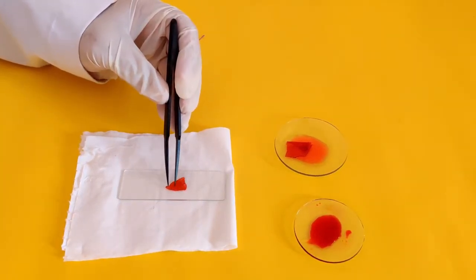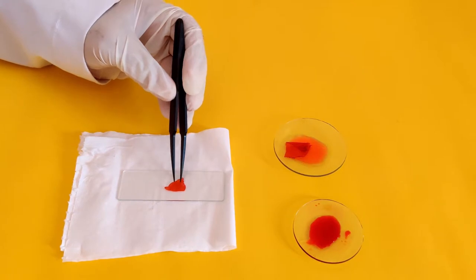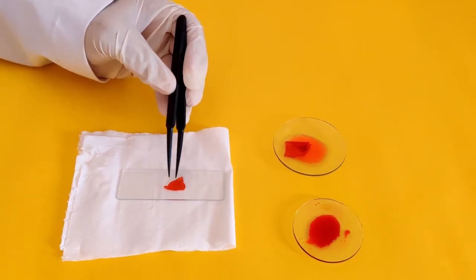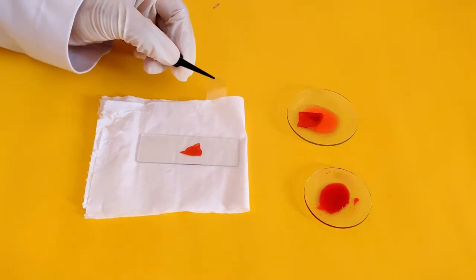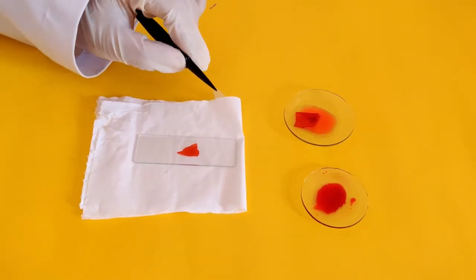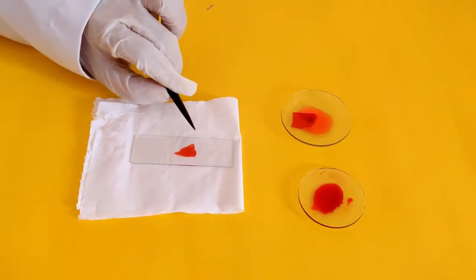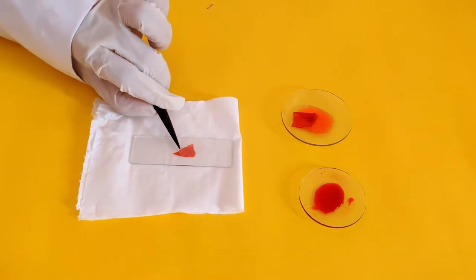Make sure the tissue is laying flat on the slide and does not have any folds in it. Now, cover the tissue with cellophane tape or a transparent sticker such that the tissue is fully encased.